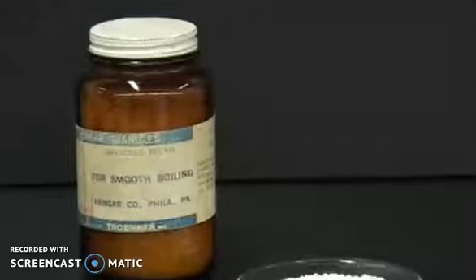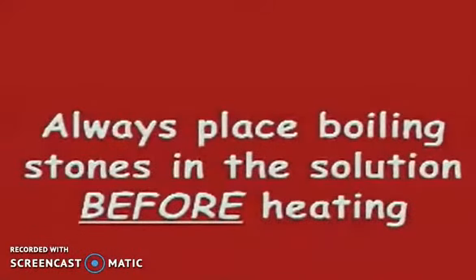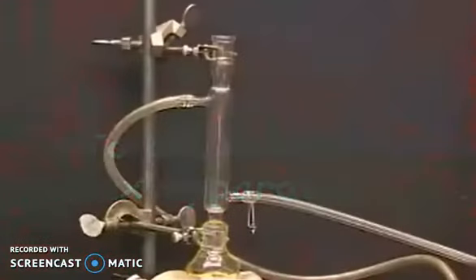Always place boiling stones before heating the solvent. If boiling stones are added to a hot solution, the liquid may instantaneously boil and shoot out of the flask. Now assemble the reflux apparatus.